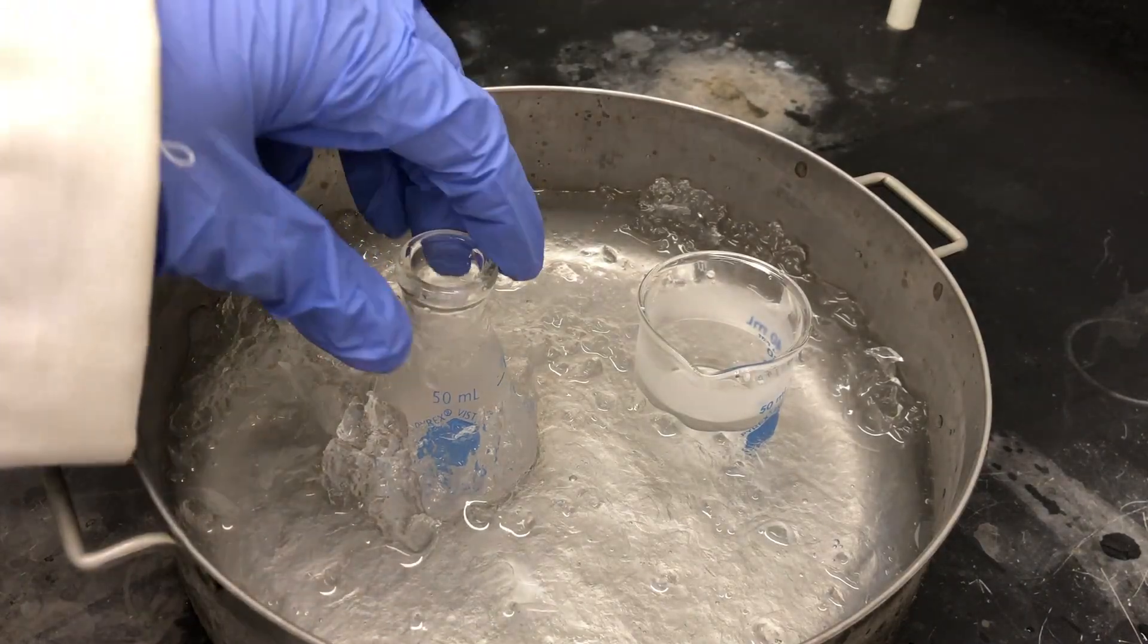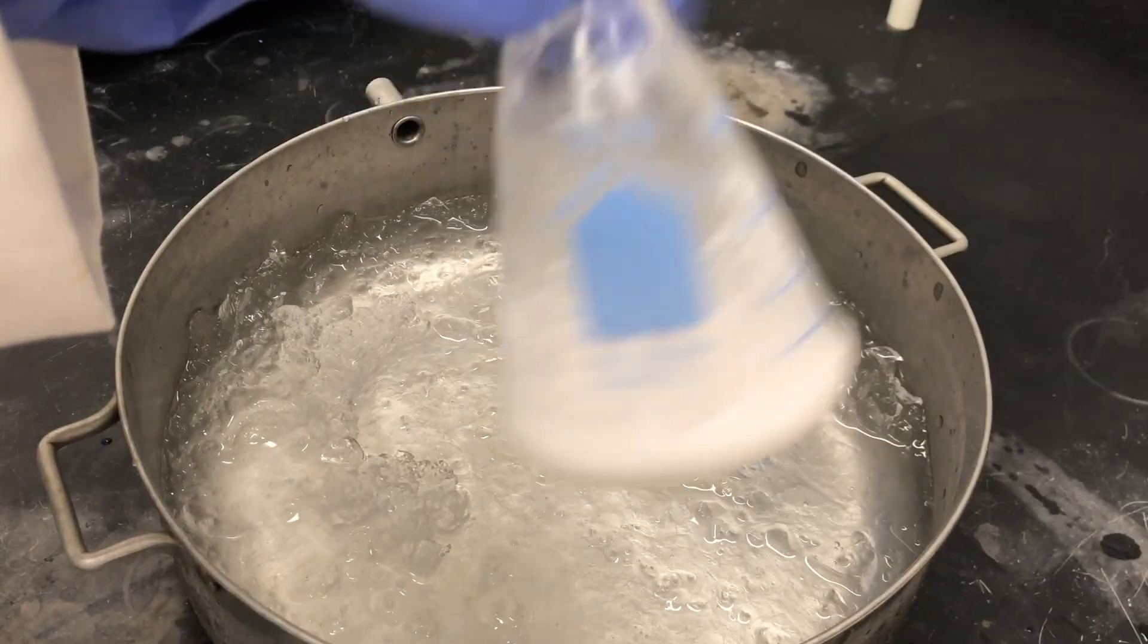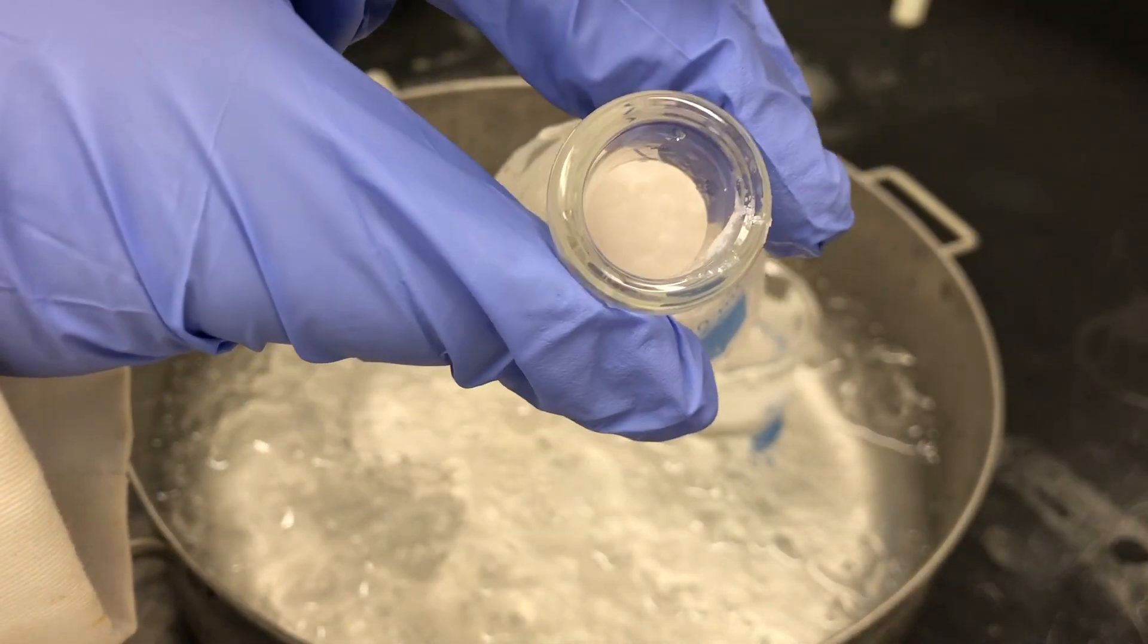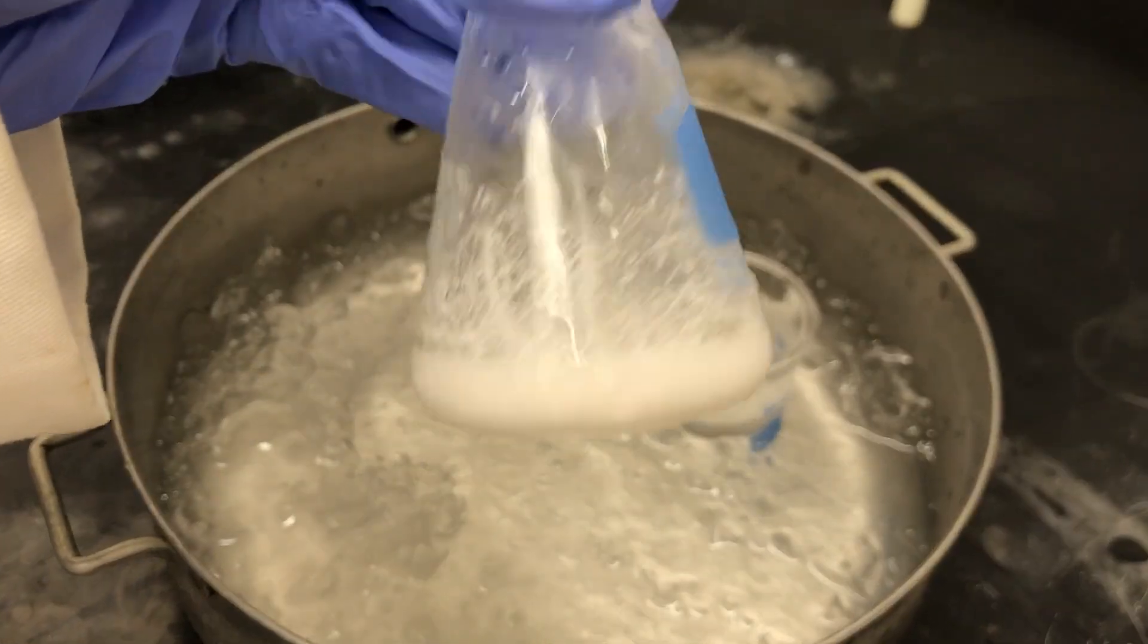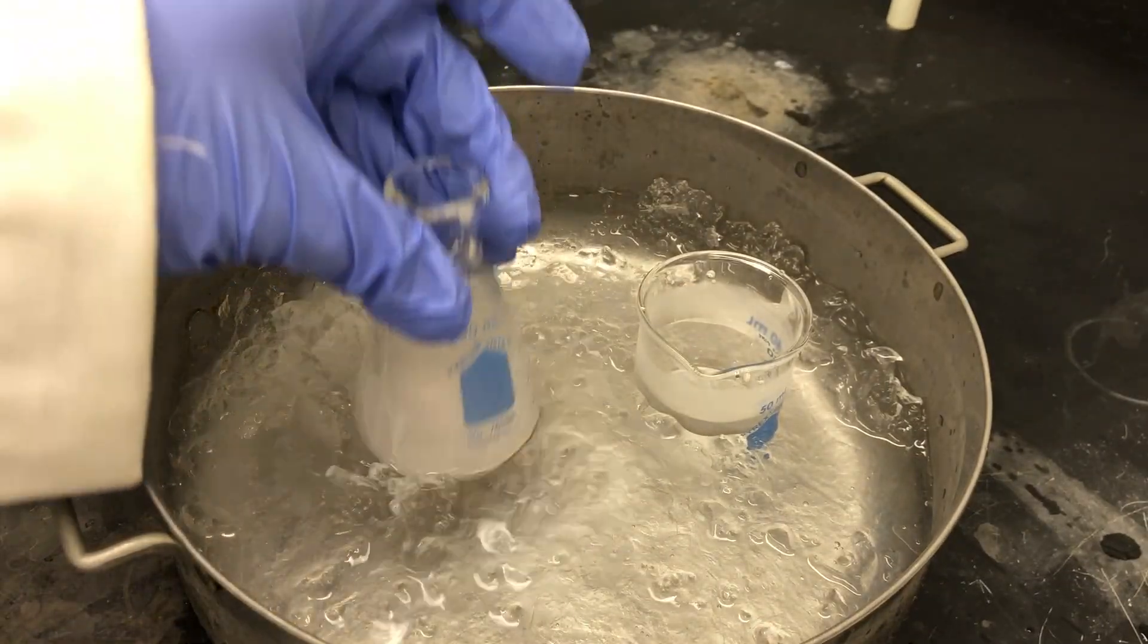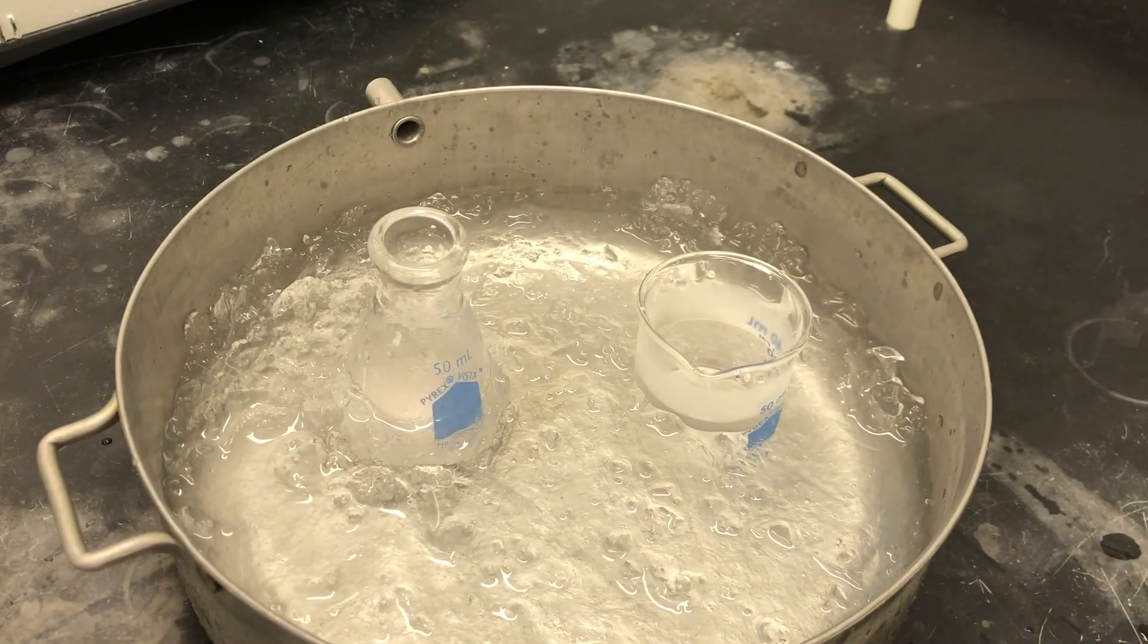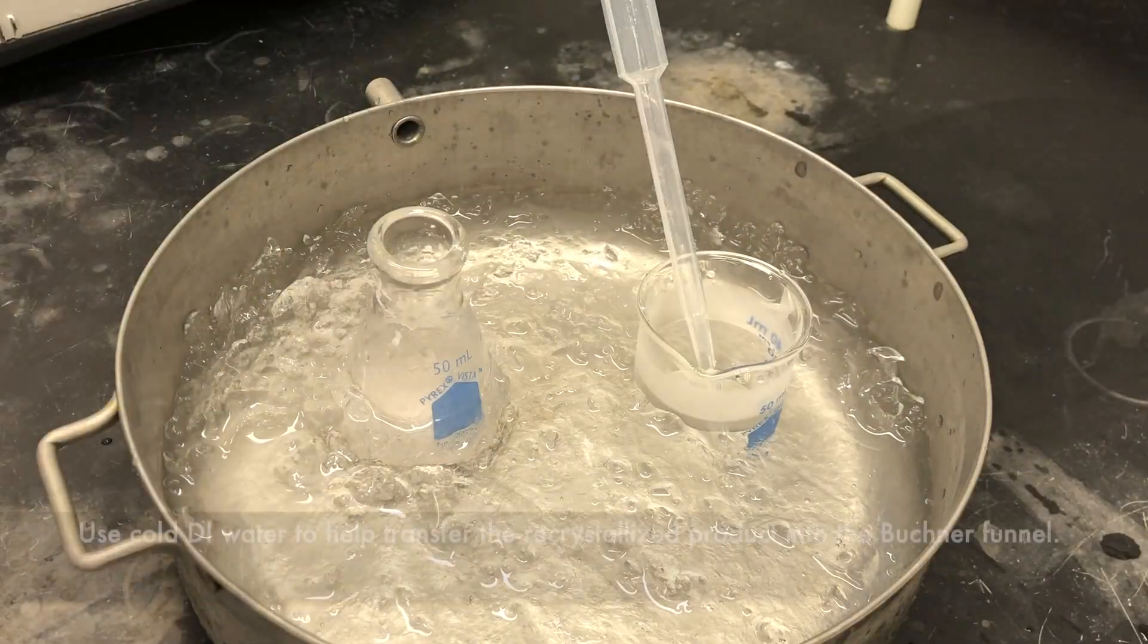Now that we've allowed it to stand for some time, if you take a look we do have our recrystallized product. Next we'll be vacuum filtering our product and washing it with a few portions of cold DI water.